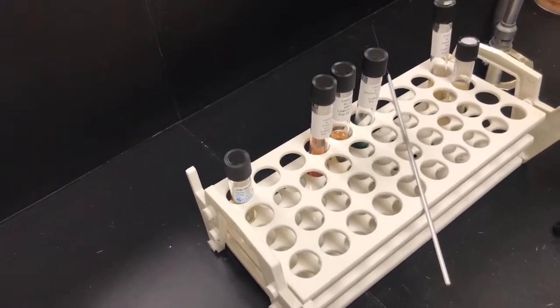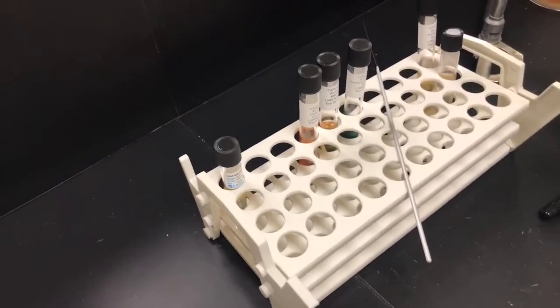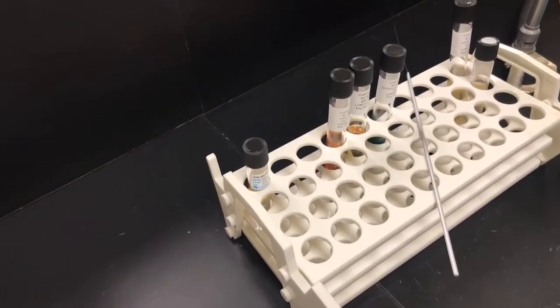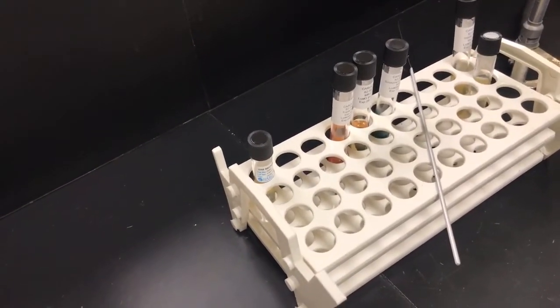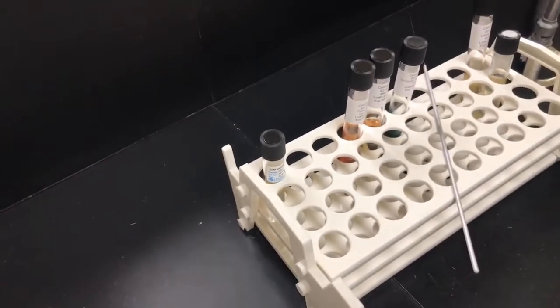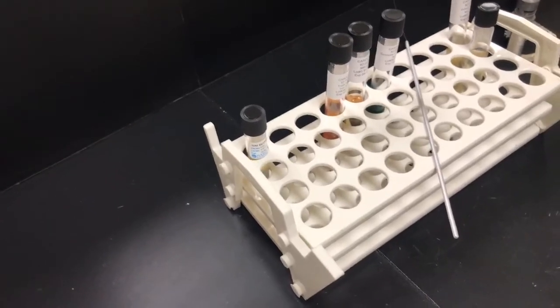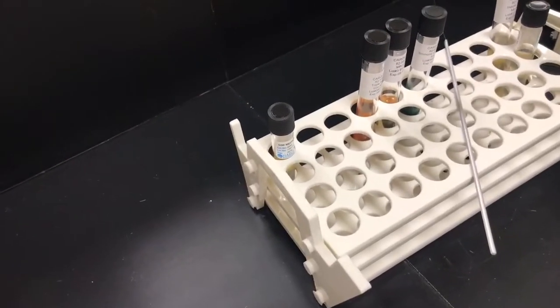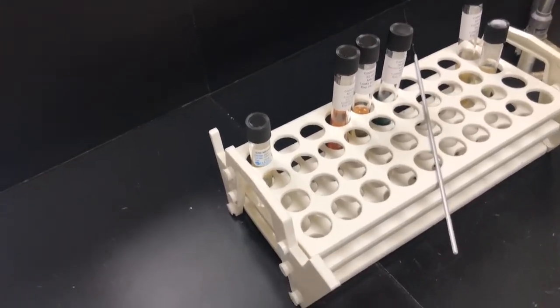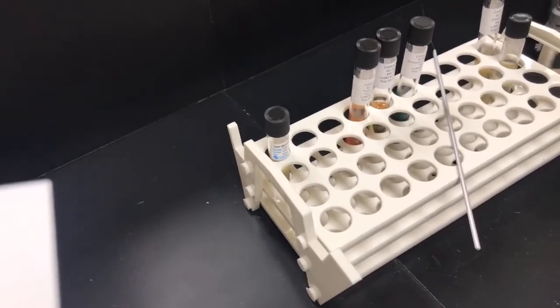And then the sulfide comes about because some of the bacteria can produce hydrogen sulfide through metabolizing sulfur-containing amino acids. This media, this SIM, contains sulfur-containing amino acids plus metallic ions like iron, which are going to act as indicators when they combine with hydrogen sulfide, and you'll see a black precipitate if that bacteria is able to metabolize that.